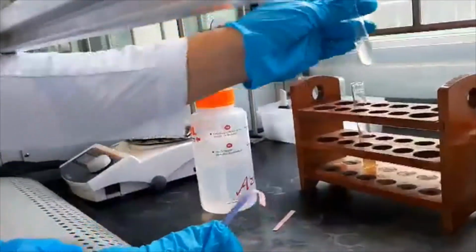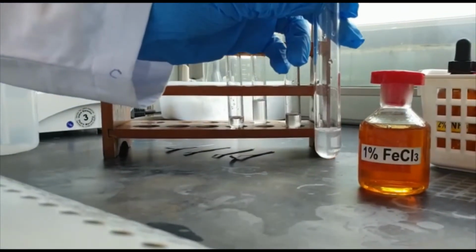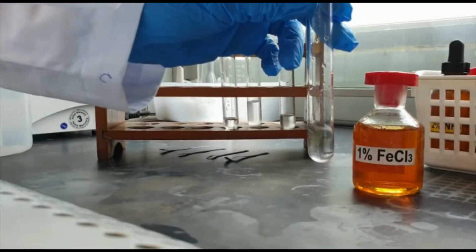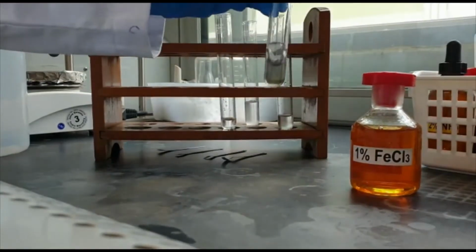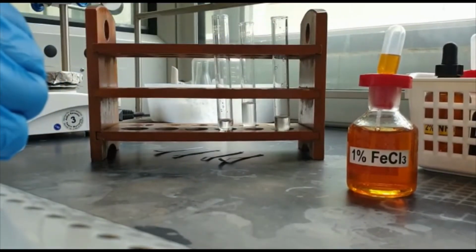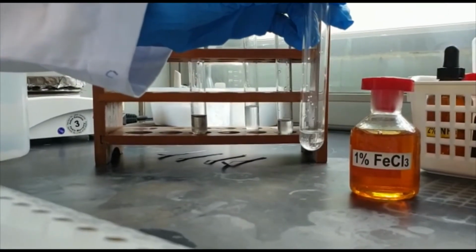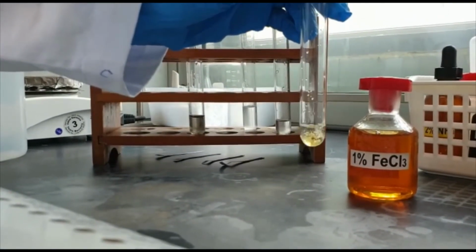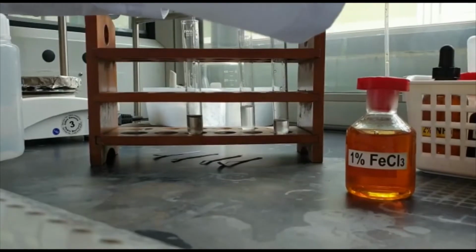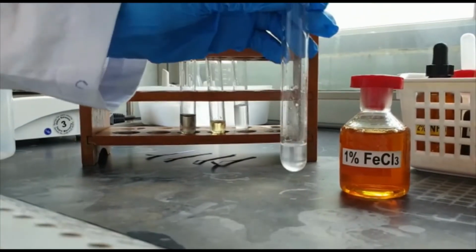it as aspirin. Here, May adds a few drops of aqueous iron chloride to test tube A and shakes it a little. As we can see, the yellowish-brown solution turns darker to a greyish-brown. Although that was not the color change we were expecting, which is violet, drug A is the only one that reacted with iron chloride, because for B and D, the iron chloride remained yellowish-brown. Thus, we conclude A contains phenol and is paracetamol.